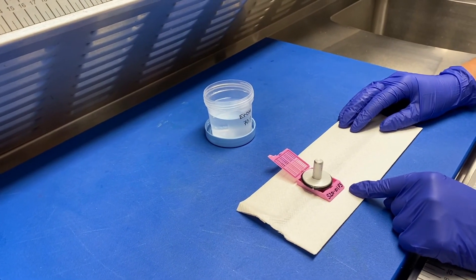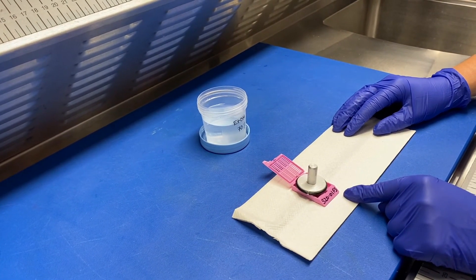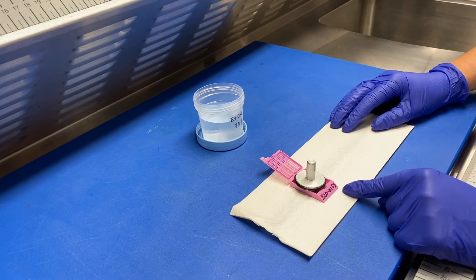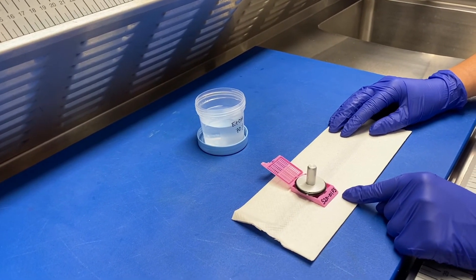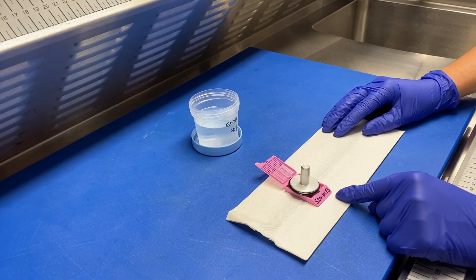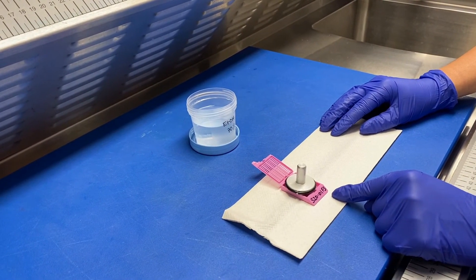Do not, under any circumstances, run the chuck under water over a drain. Oftentimes students do this thinking that it's going to speed up the melting process, which it does, but then they lose their tissue specimen down the sink.